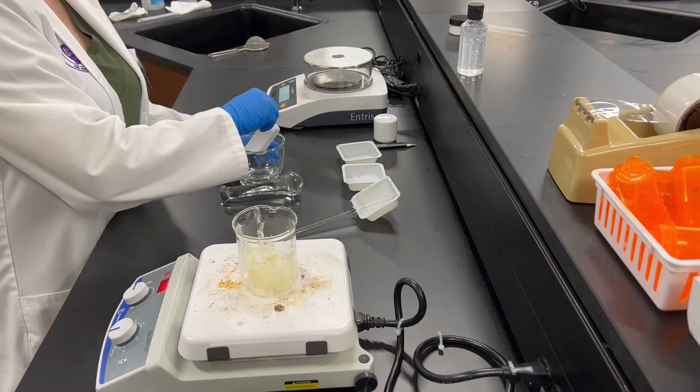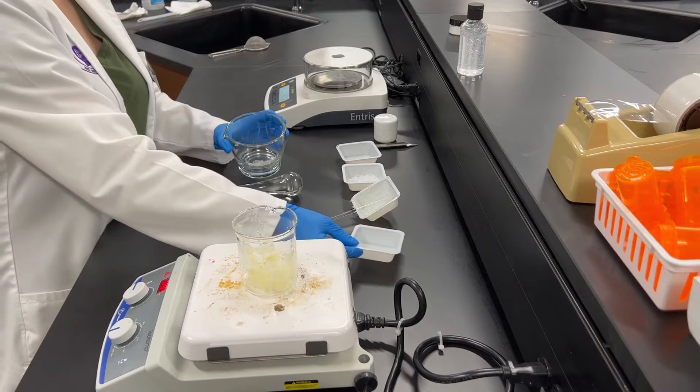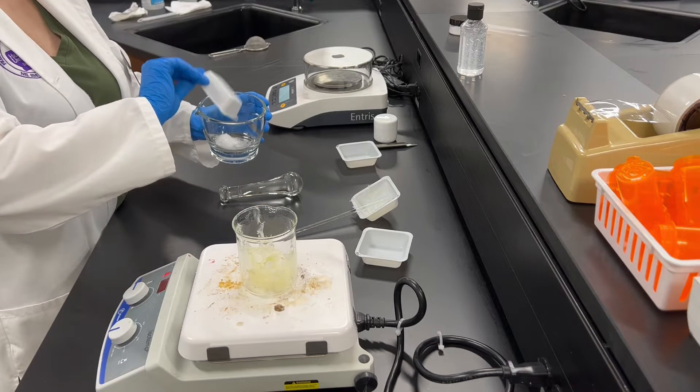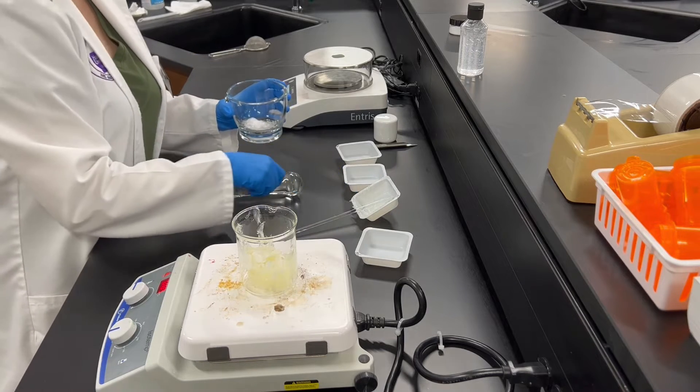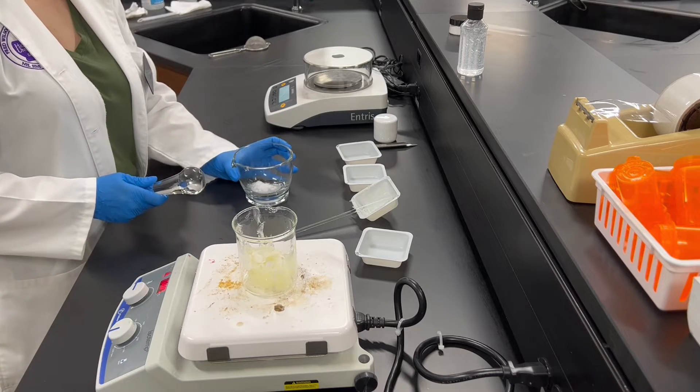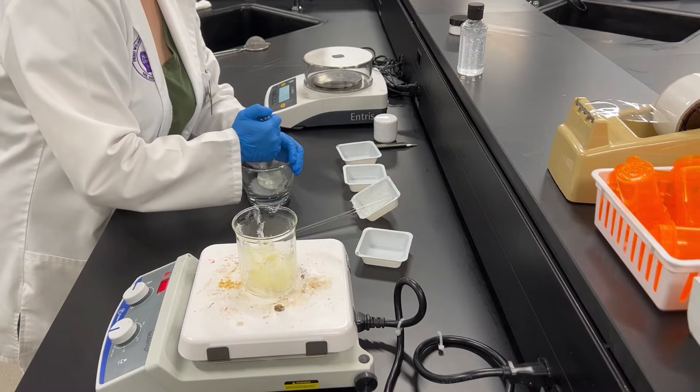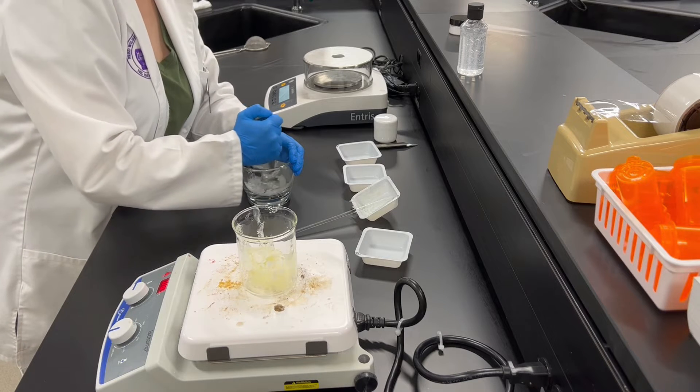Then you can go ahead and take your menthol crystals and your camphor and mix it into a pestle and mortar. As you are mixing these two ingredients together, it is going to create a little bit of liquid, which is going to be okay.